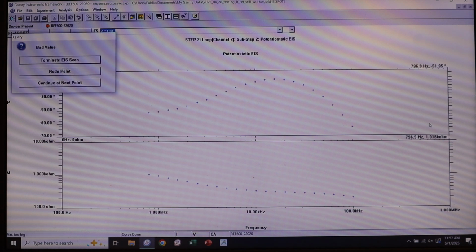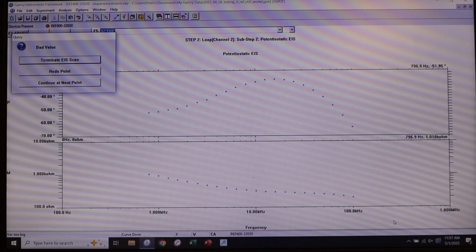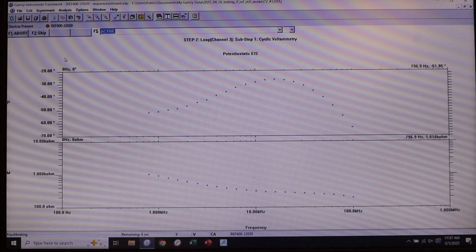And so clearly we have everything hooked up correctly, so we have our reference electrode and our working electrode and our counter electrode all in place. They're all clearly connected to the Gamry. So something's wrong. And this time it didn't even do the discontinuity, right? This time it just stopped halfway through the measurement and says there's a bad value. And so we'll just terminate this experiment. So now we'll start looking at channel 3.